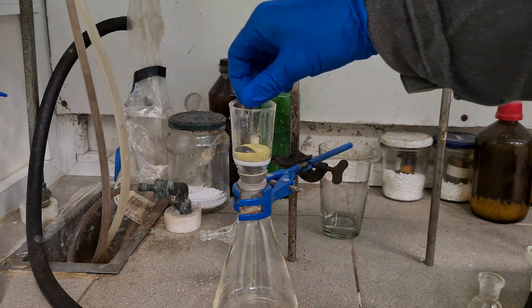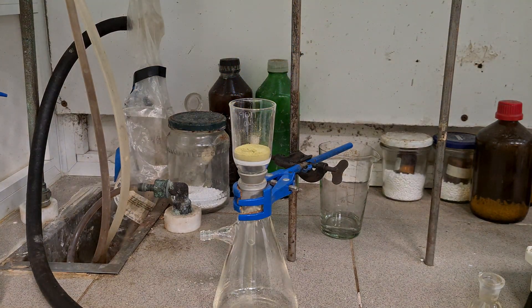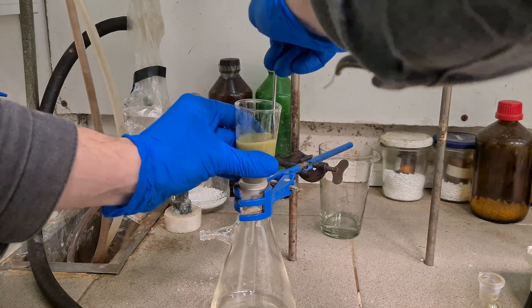Then remove the stir bar and wash bis-triphenylphosphine-palladium dichloride with diethyl ether, three times, 30ml portion each.